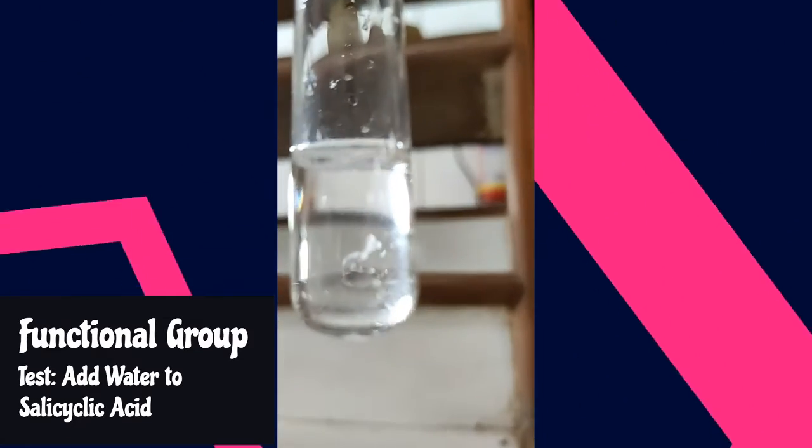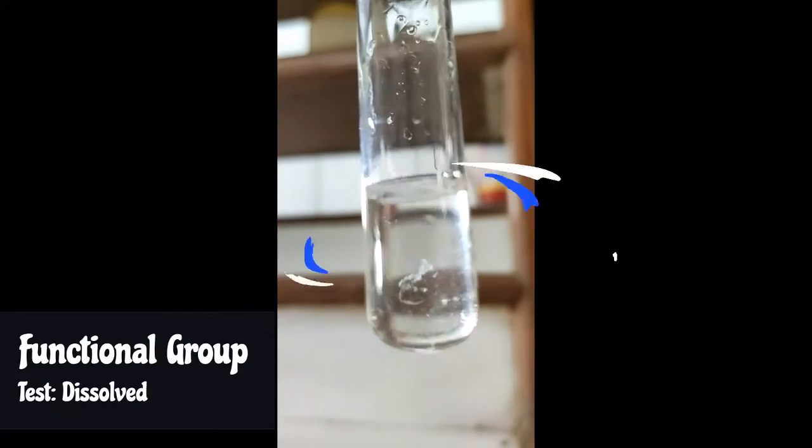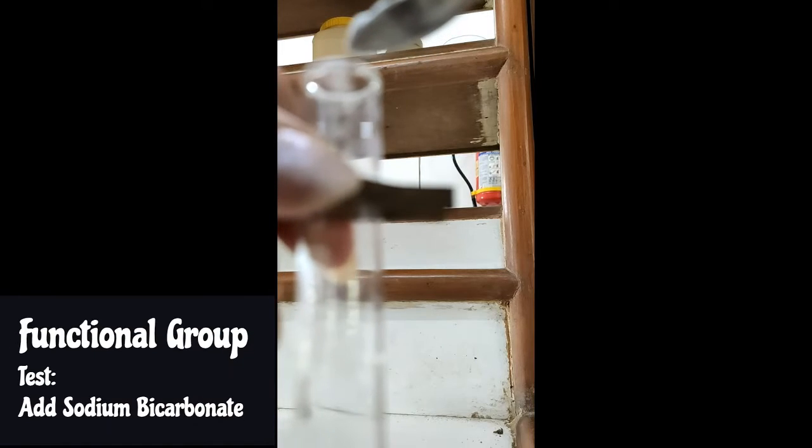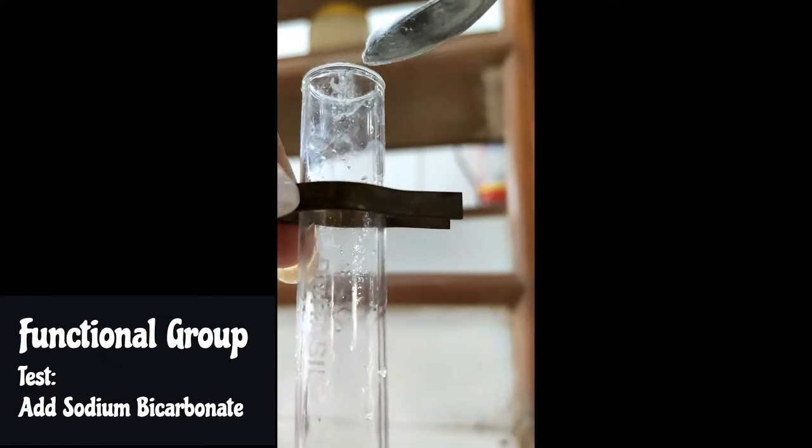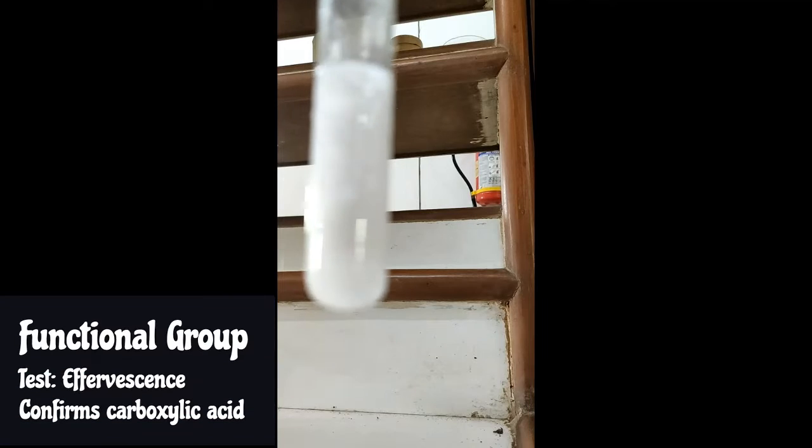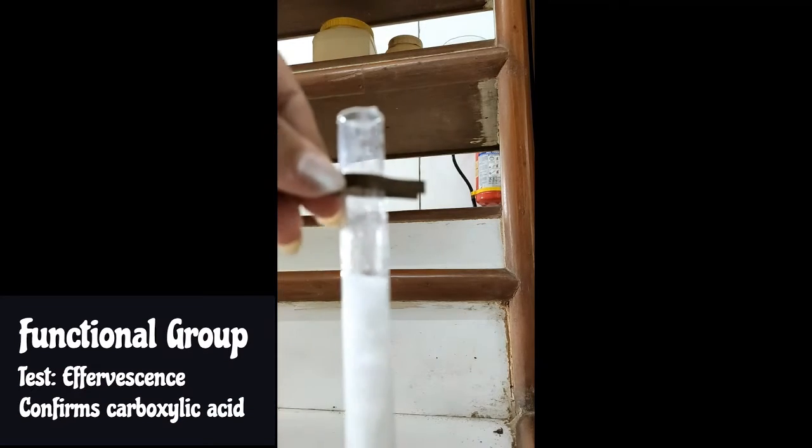To the solution, you have to add sodium bicarbonate. Once you add sodium bicarbonate, it will react with the compound. Obviously, if acidic COOH group is present, then CO2 will be released.